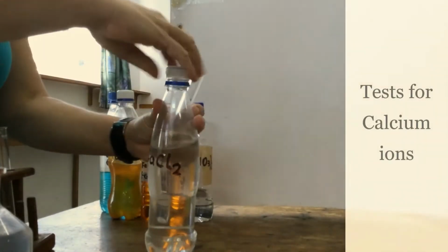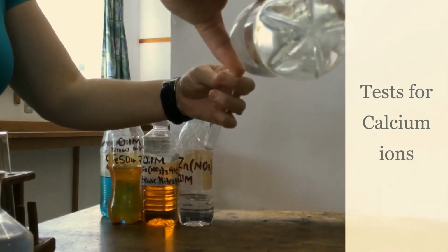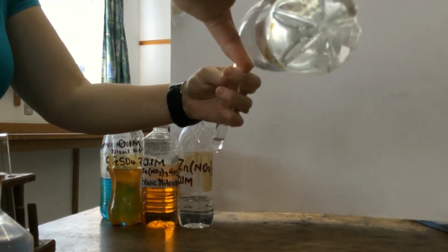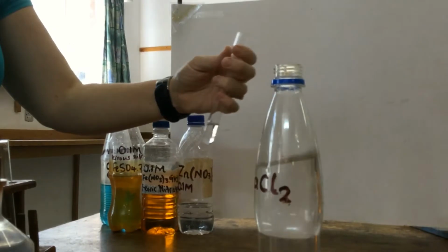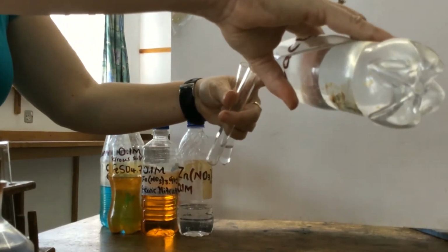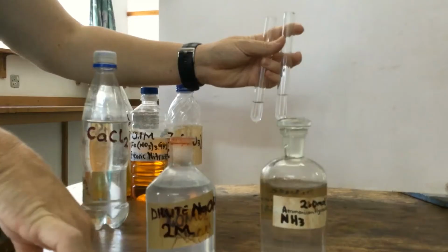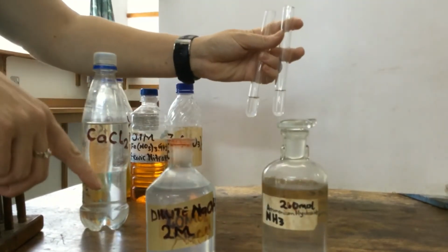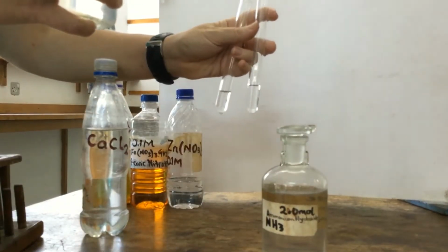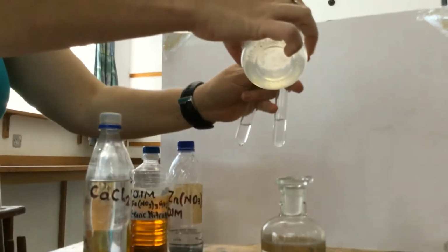We'll take a test tube and we're going to add a small amount of calcium chloride, this is any salt of calcium, to each of 2 test tubes. I'm putting it in 2 test tubes because I'm going to do both tests at once so we can look at the results and compare them. I'm going to add dilute sodium hydroxide to one and dilute ammonium hydroxide to the other. So for calcium, we are hopefully going to see a white precipitate.